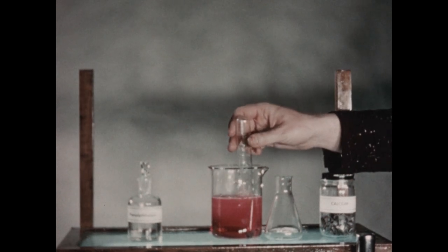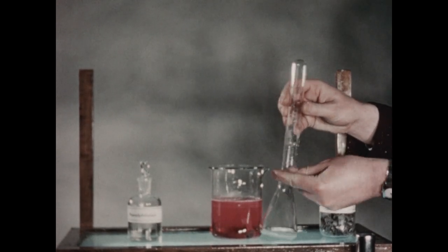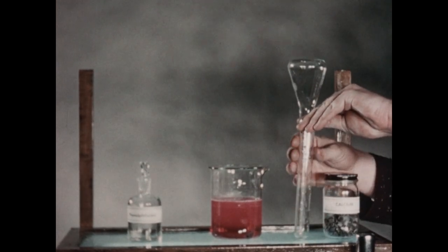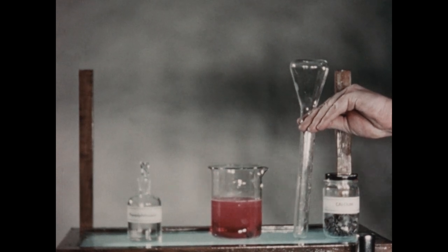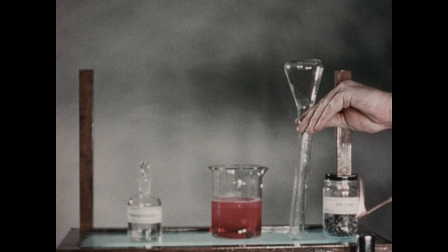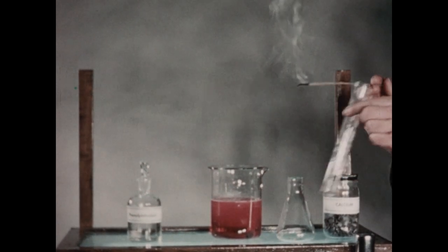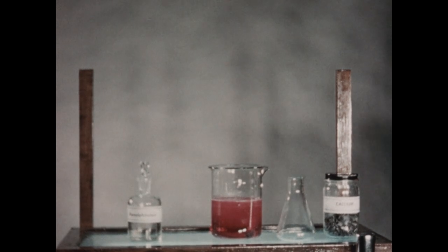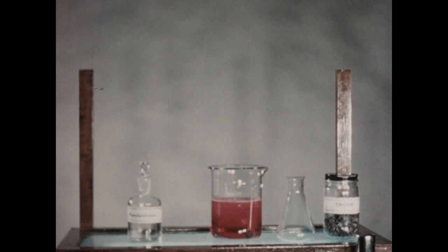The Erlenmeyer flask, simply filled with air, we'll place the test tube mouth to mouth with the flask and then invert the setup so that the hydrogen will diffuse rather rapidly up into the flask and the air will pass down to the test tube. Now we'll light a wooden splint at the Bunsen burner, place the tube in the flask, and from the explosions that we obtained, hydrogen was obviously formed when the calcium reacted with the water in the beaker, along with calcium hydroxide.